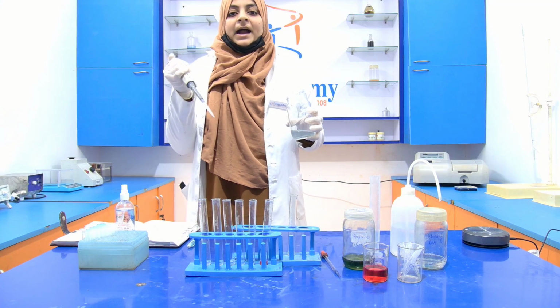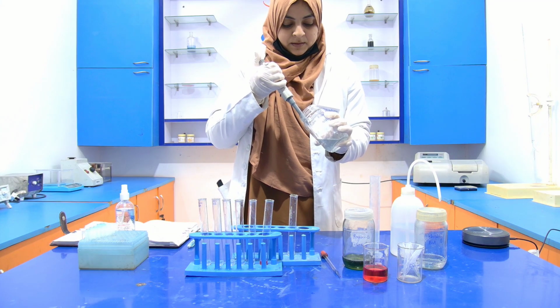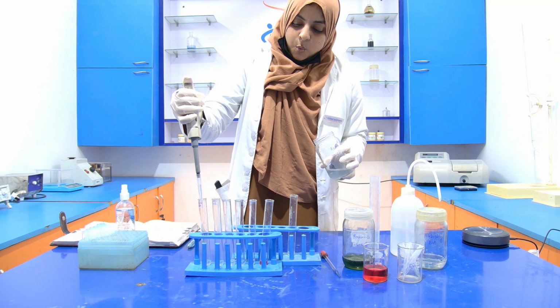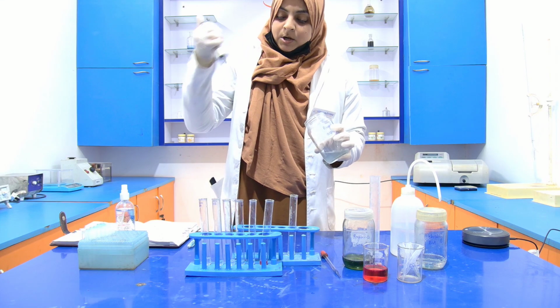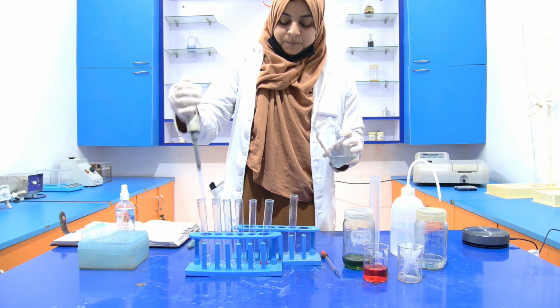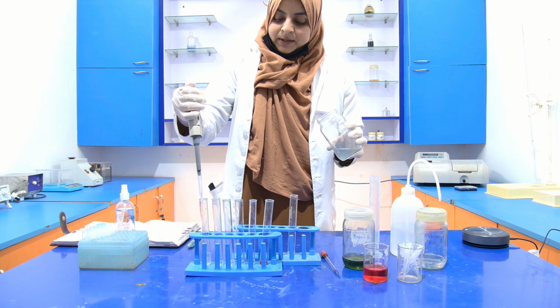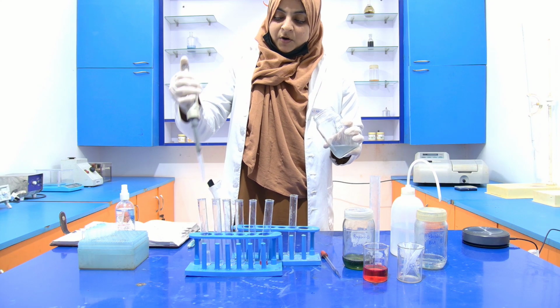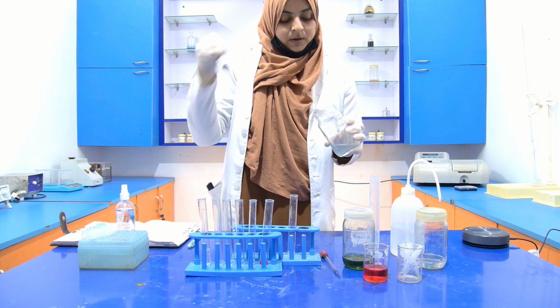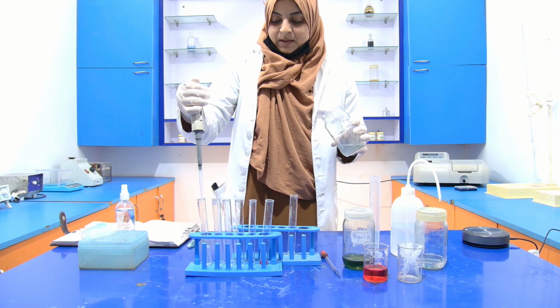Now I am going to add 5 ml into the first test tube. 1, 2, 3, 4, and 5.